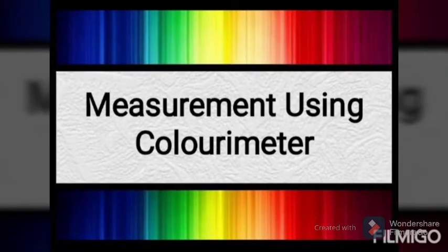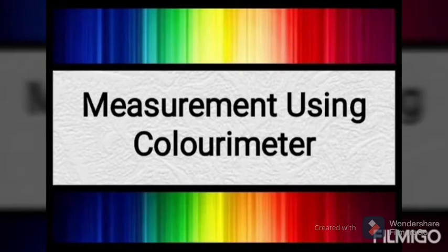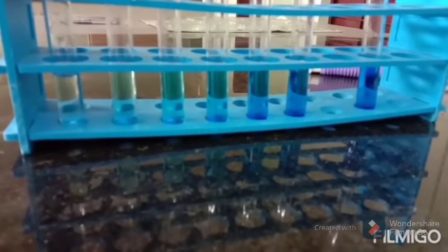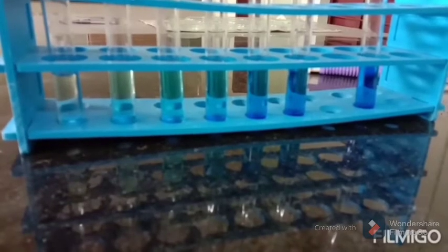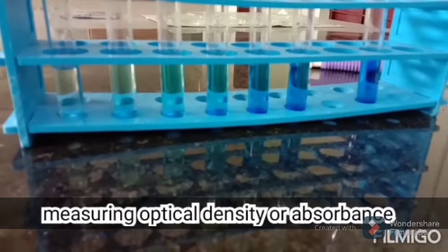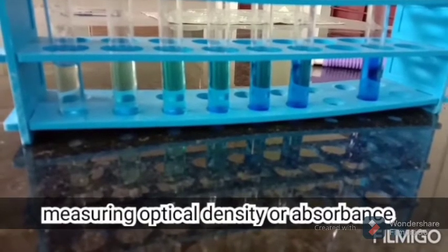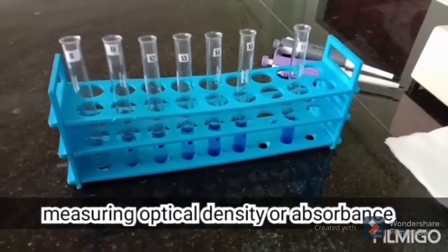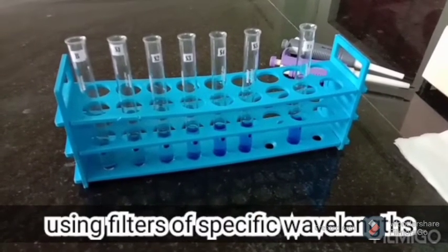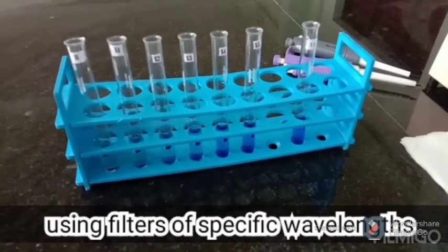Now basically, we do some color reactions in biochemistry to detect substances. And you can see here a series of test tubes having a gradient of colors is placed. We're actually seeing a series of standards taken for the purpose of measuring using colorimeter. Our target here is to measure the absorbance or optical density of these colored solutions, which will be done with a specific wavelength filter and a colorimeter.